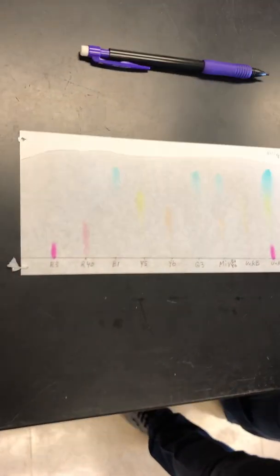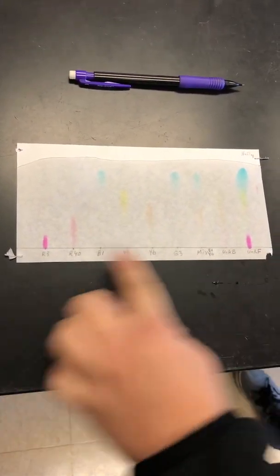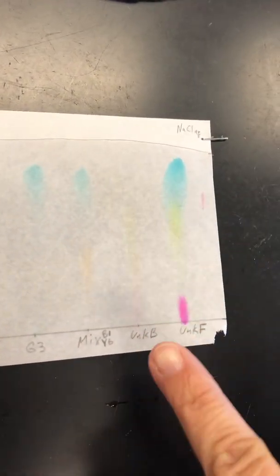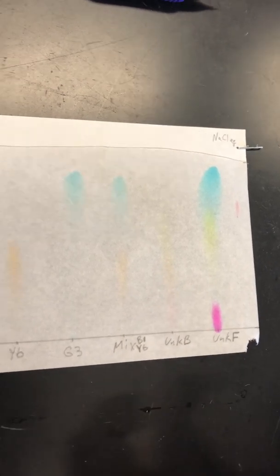So now what we want to do is we want to be able to compare. Now you can kind of do a visual comparison, seeing like here's our B1 and our Y6. You could kind of see them visually. But the goal is to figure out what is in our unknown. You have 3 different colors, 3 different dyes, and each of these unknowns. So that's kind of what we're doing. So one thing you could do is a qualitative look, like, which one do you think that one is? But we also want to do quantitative measurements.